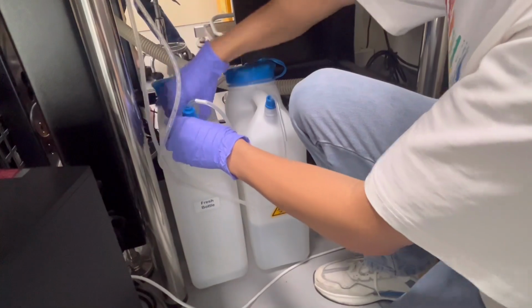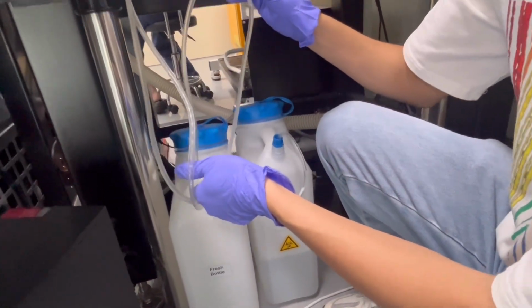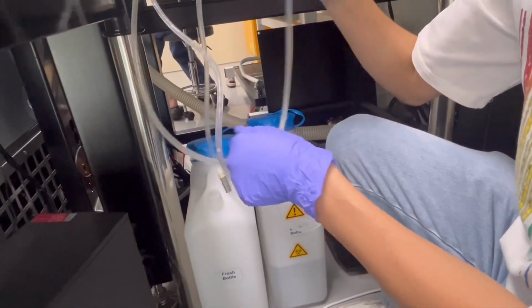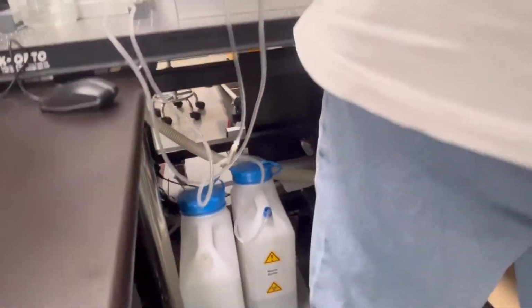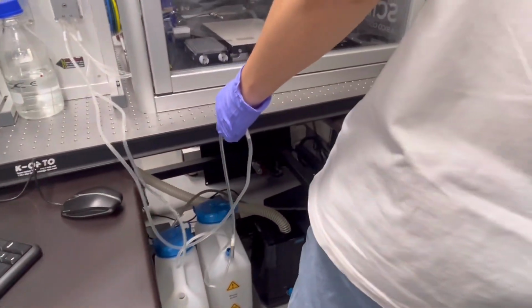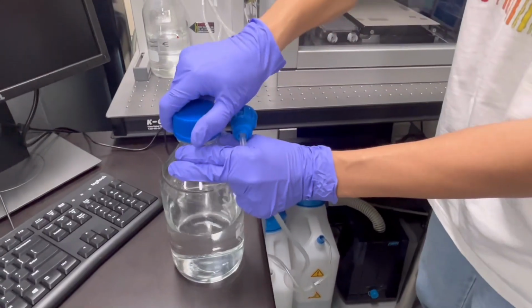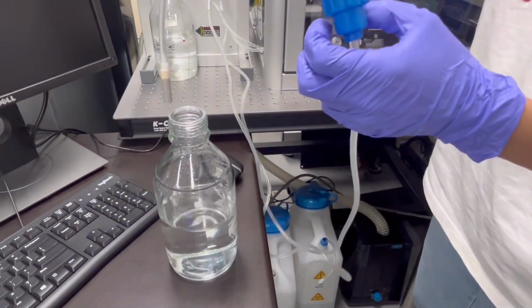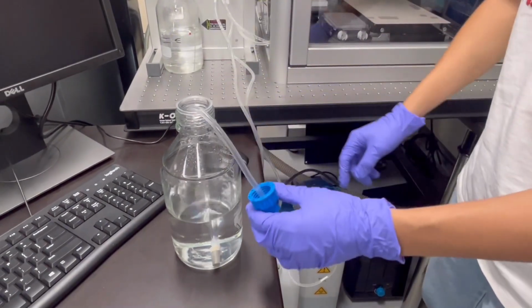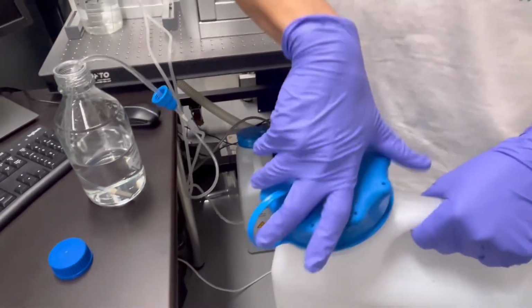Like we open this one and we refill the water.